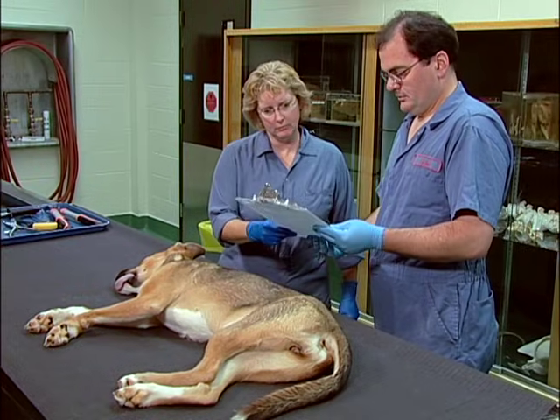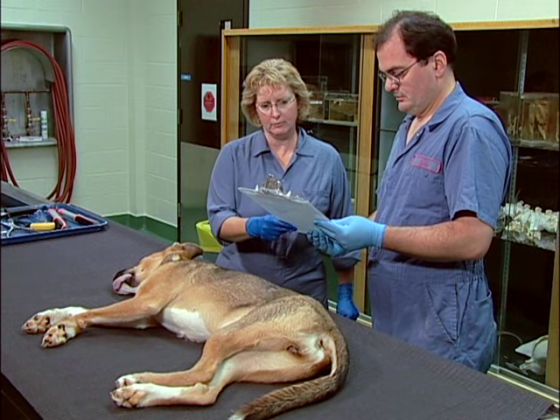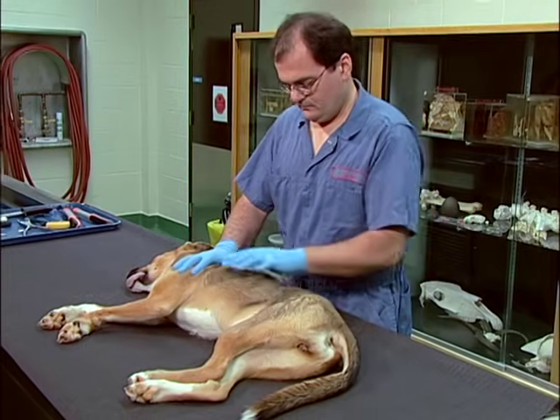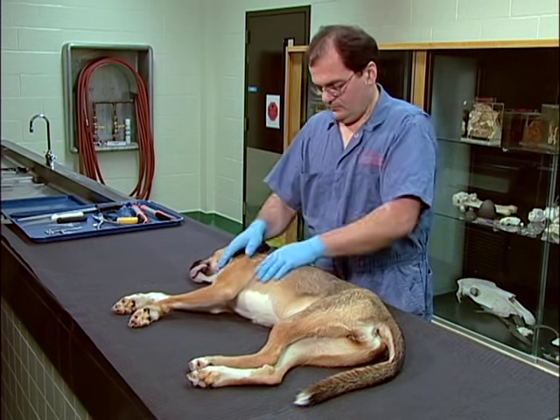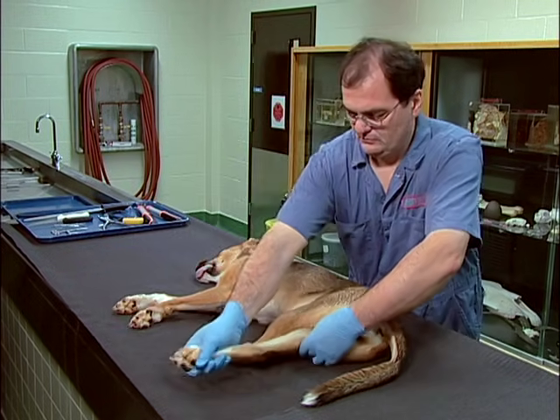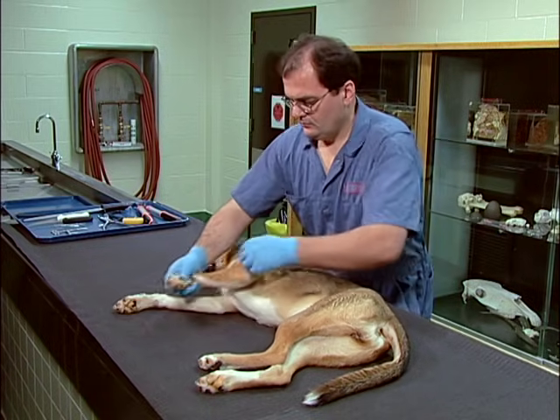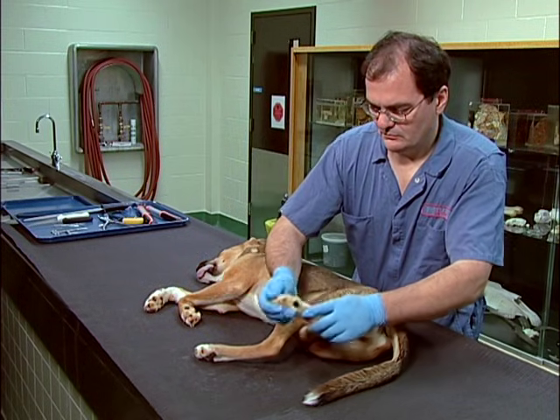External examination. Before starting the necropsy, the pathologist must read the complete clinical history, including the signalment of the animal and the clinical problems. Special attention should be paid to questions raised by the submitter. Record identifying tags or tattoos and color patterns of the animal. Weigh the animal and determine the body condition and nutritional status. Evaluate hydration status based on the skin turgor test and appearance of eyes. Examine the limbs by visual inspection, palpation, and flexion to detect potential fractures and joint disease. Examine the foot pads and toenails.